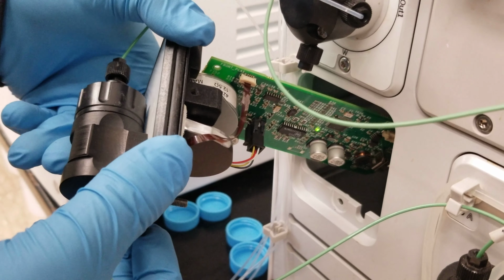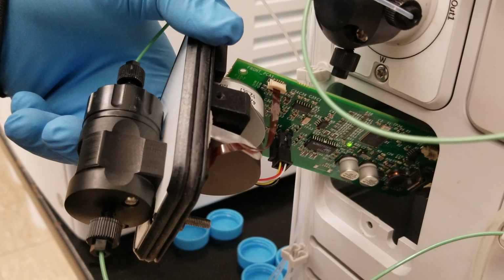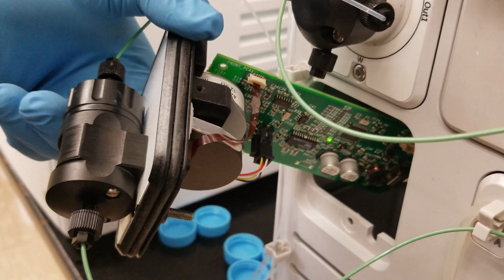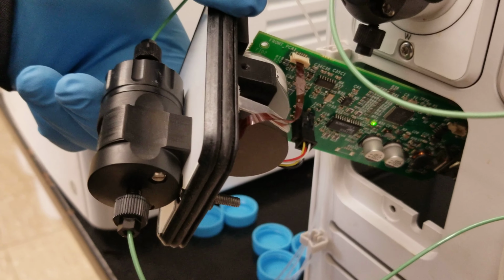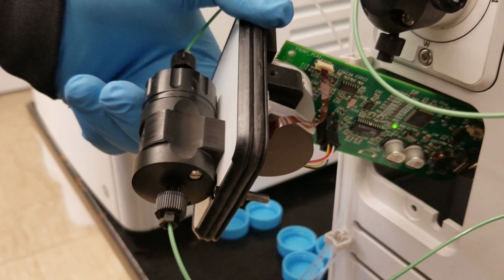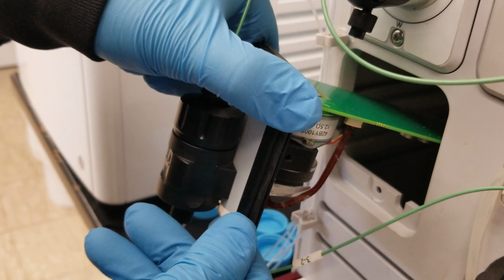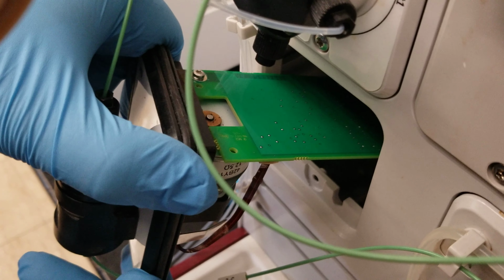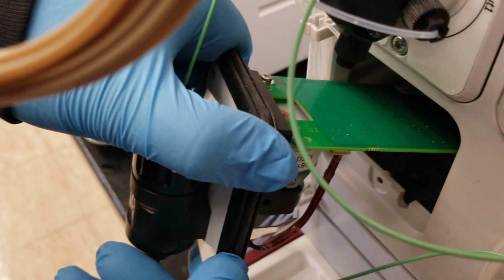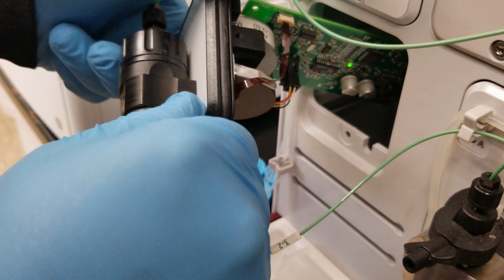Or maybe it needs some sort of lubricant, because it's a moving part. Exactly. Because what we were thinking, that when it is paused, it's not moving, but it is moving. Yeah. And now since you have moved it, tilted it, maybe that's the reason it's not doing the sound. You can see something. Yeah, that's the place. Right. Where's the ticking? We don't hear the ticking sound anymore.